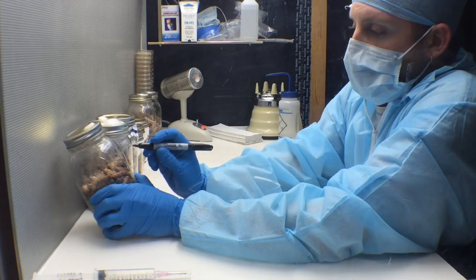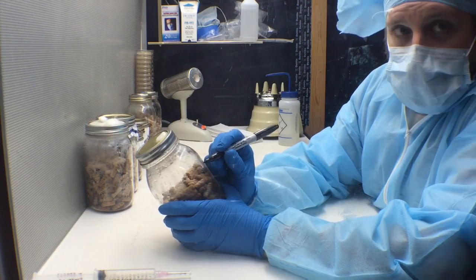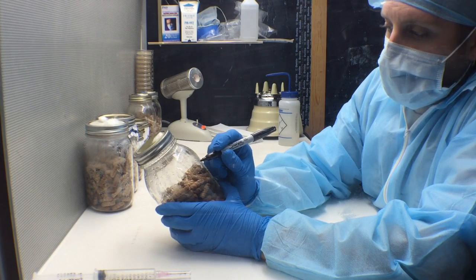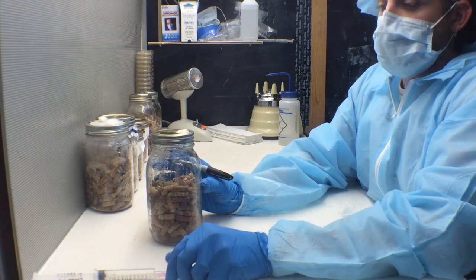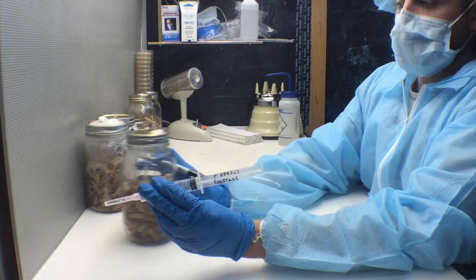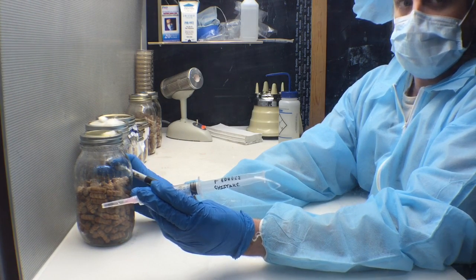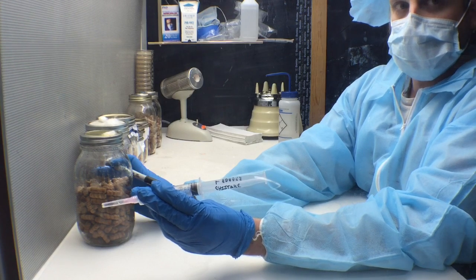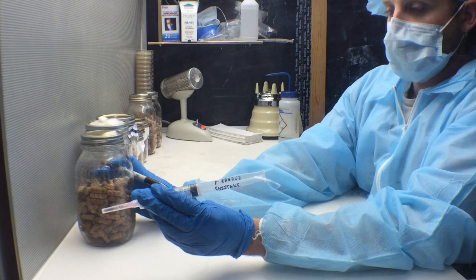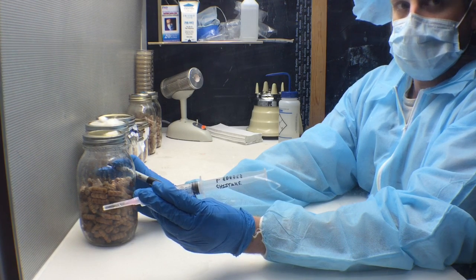On the front of the glass, you'll put the species, the date you made it, the culture you made it from, and any other pertinent information. For this culture, we made a shiitake — a cold weather strain that we received from mycosymbiotics. He is awesome, I love working with him, and I see a great future in both his company and mine. We'll label our jars and then put them into the inoculating room.